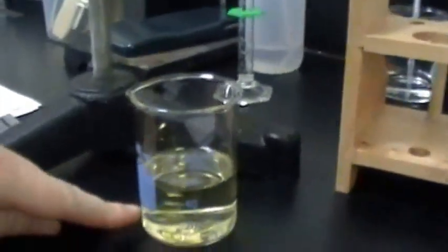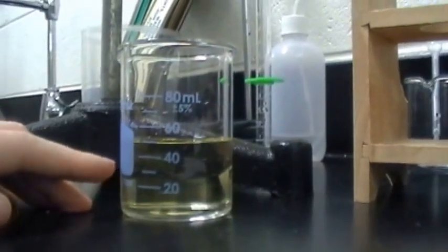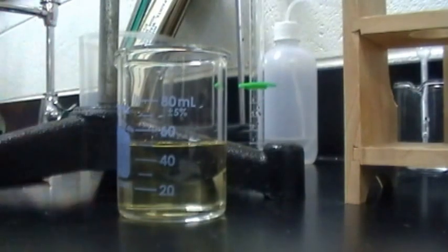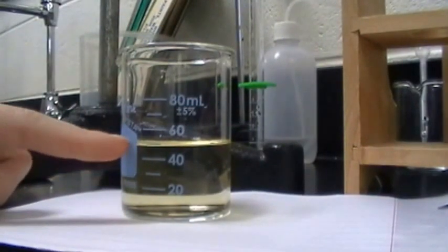Now we need sodium hydroxide — it's so pretty! So in this beaker we have 20 milliliters of white grape juice, 7 drops of phenolphthalein, and 30 milliliters of deionized water. In the burette we have 26 milliliters of sodium hydroxide.